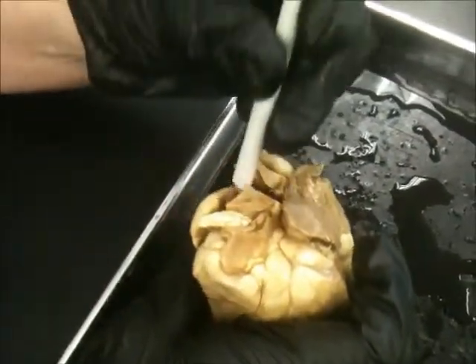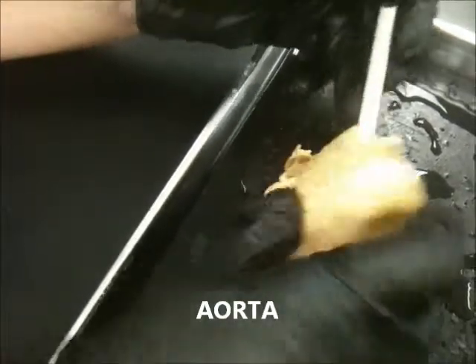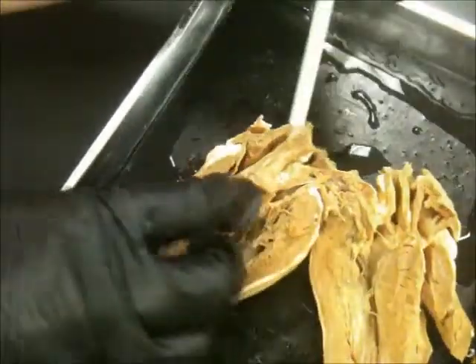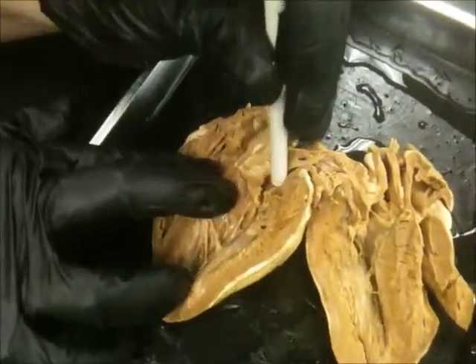So that's the aorta. Do they have pictures of a cow heart and an aorta? This is sheep. The semilunar valve is going to be up underneath there.